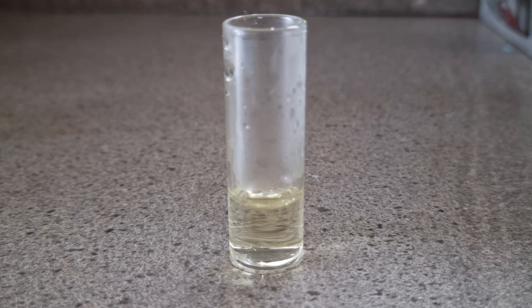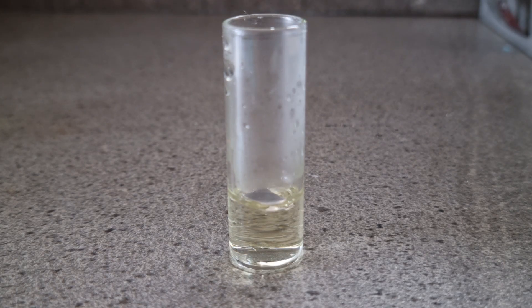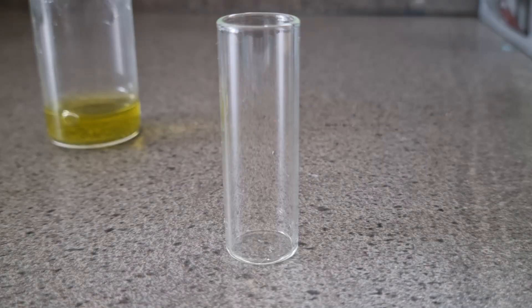Hello there, today we will be synthesizing titanium and chromium complexes containing the peroxo group.